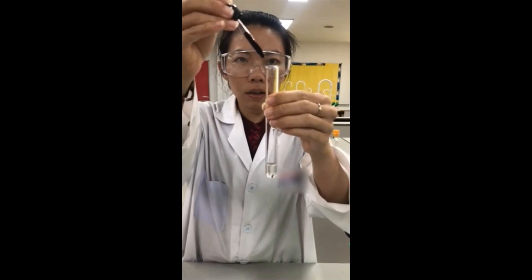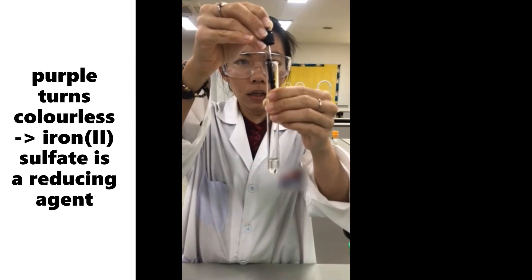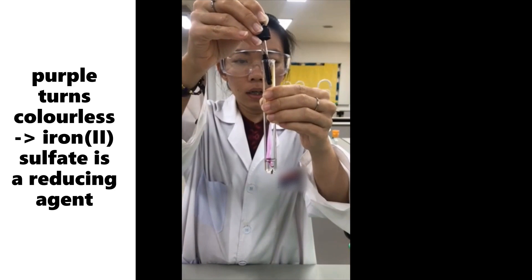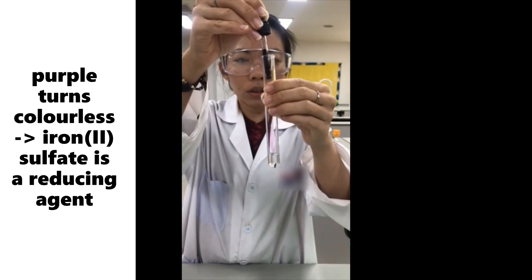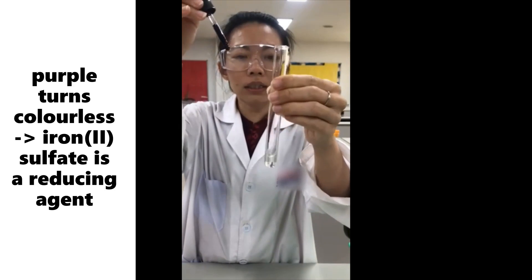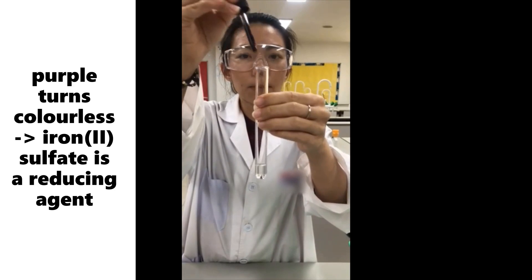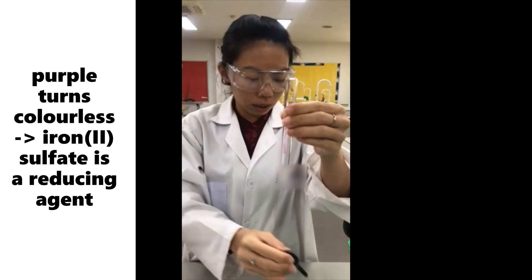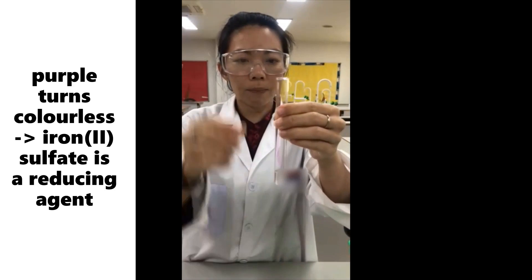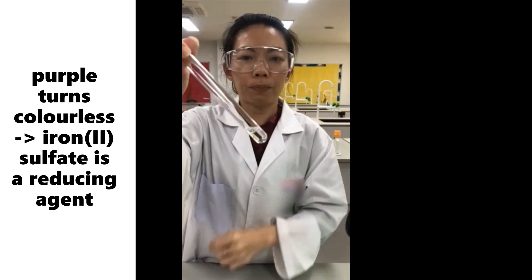The color changes to colorless — you can no longer see any purple hint in the final solution.